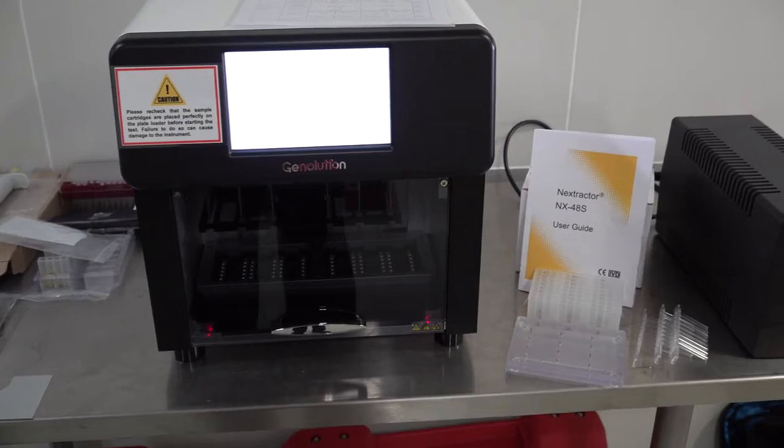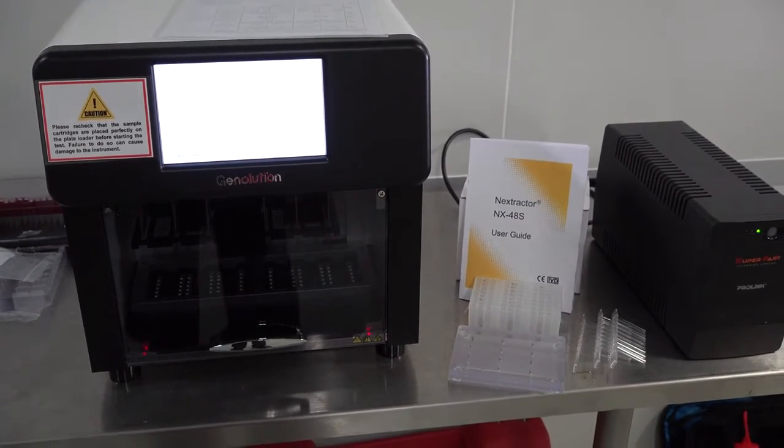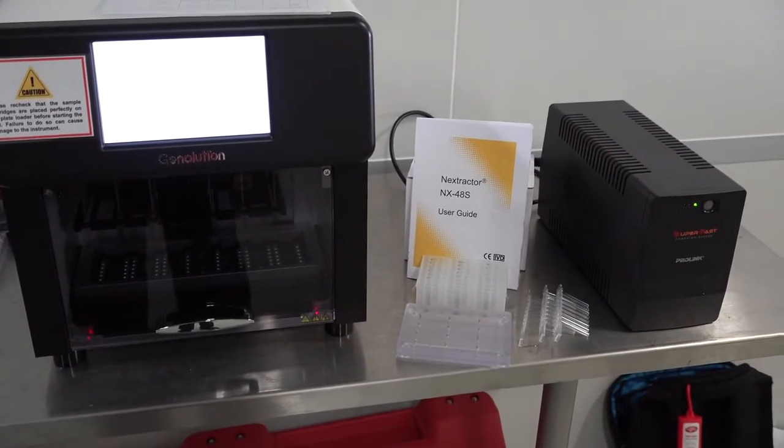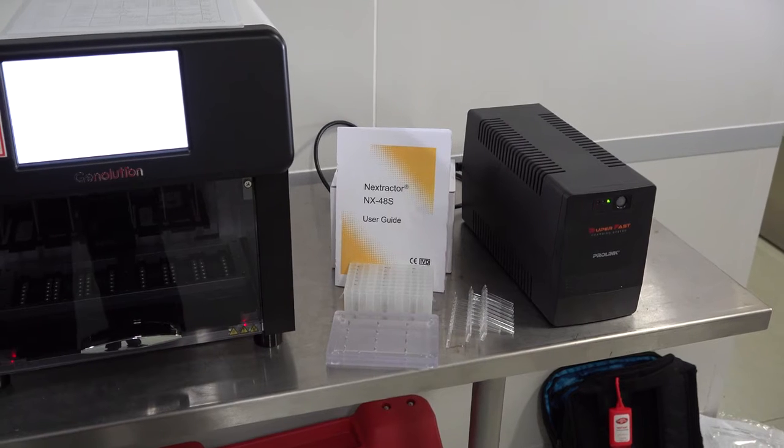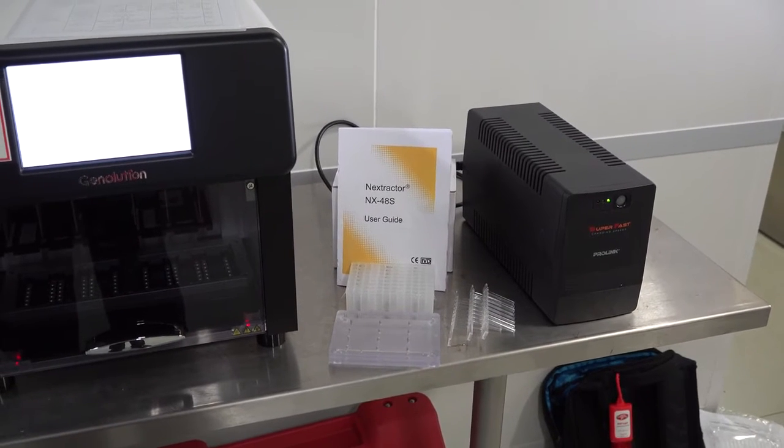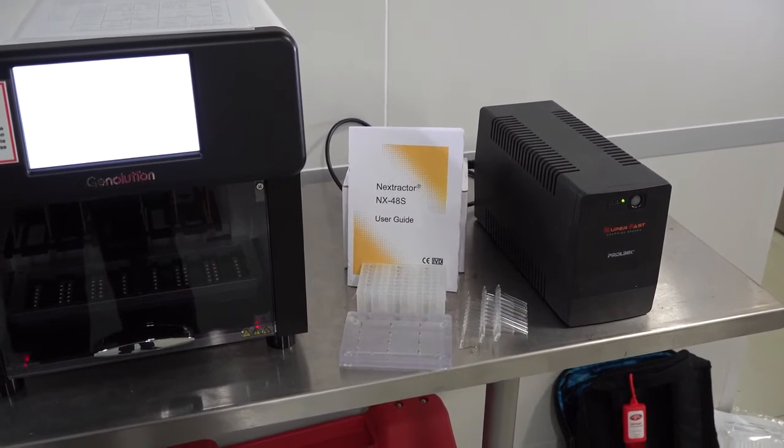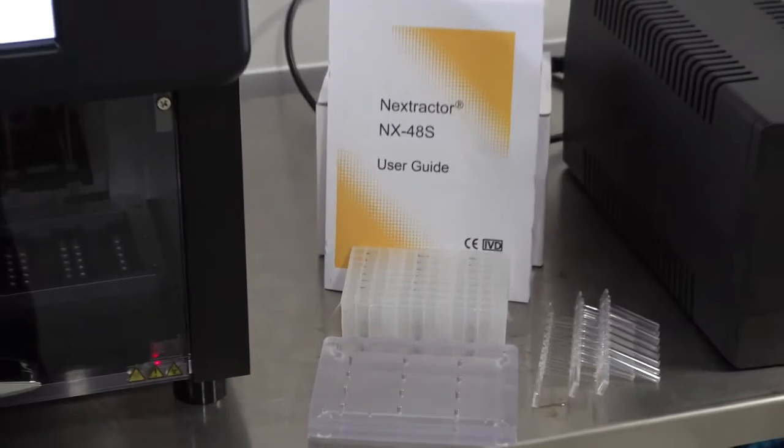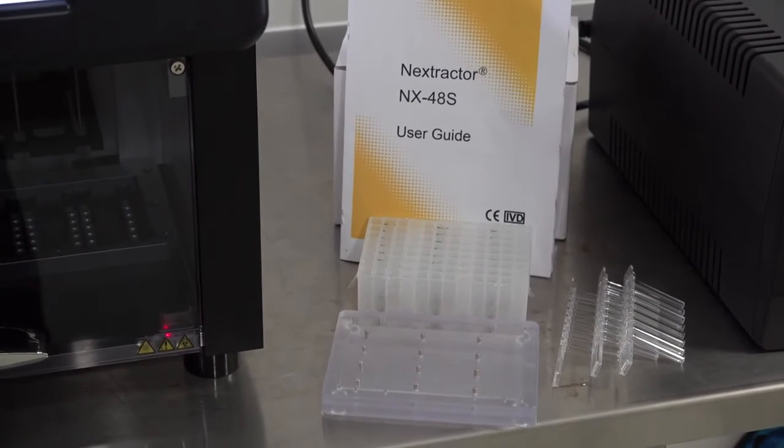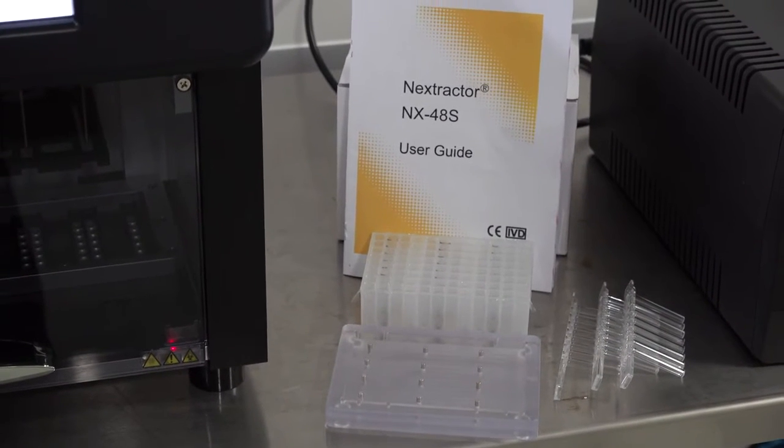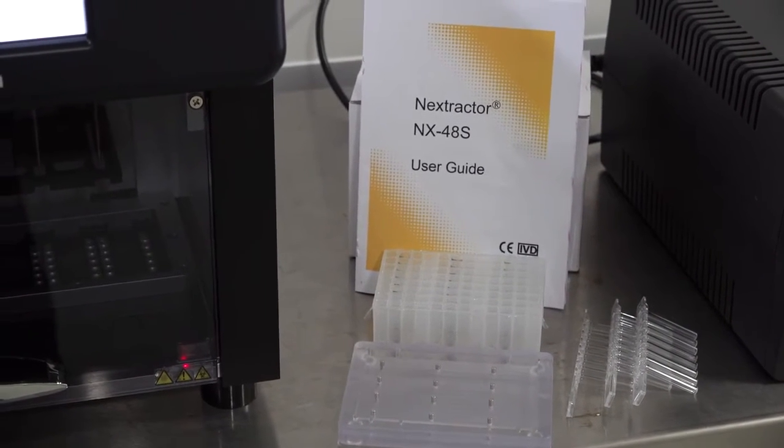We are now going to install the Nextractor NX48S which is from Genolution. This is an instrument which provides cartridge-based extraction and the entire procedure is carried out within the safety of the extraction unit.